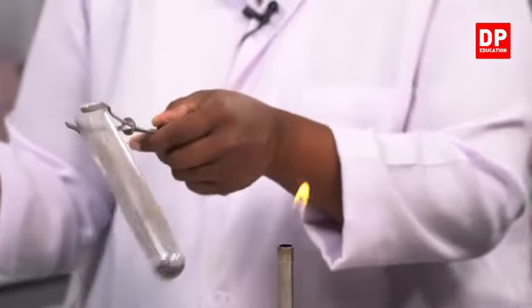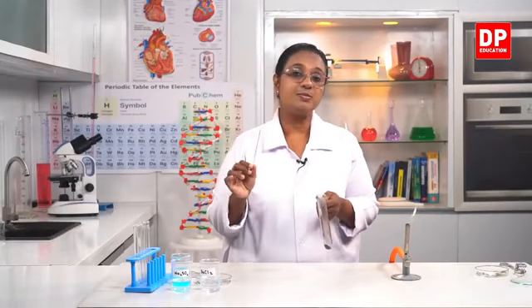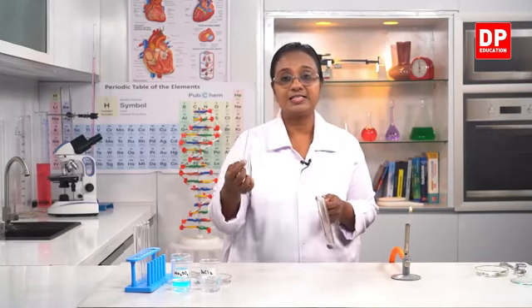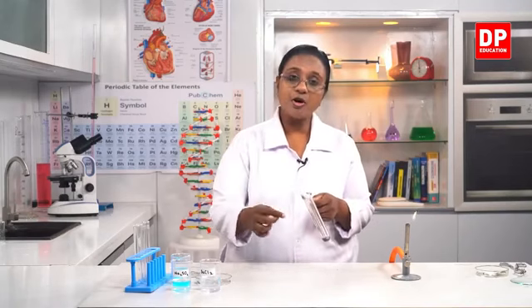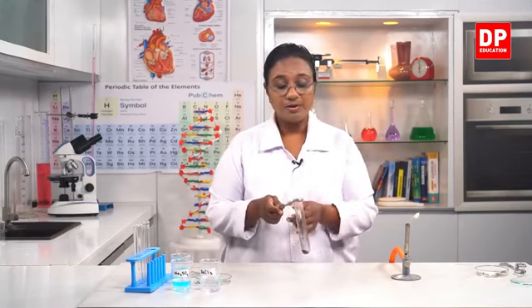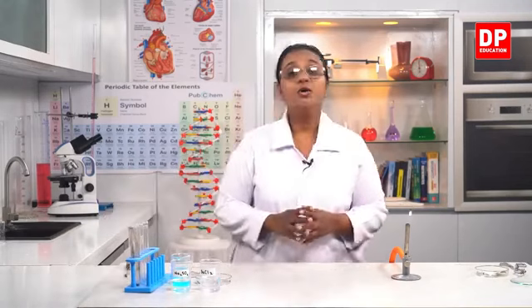So you all know, students, when there needs to be combustion, there has to be oxygen gas. So we use the glowing splinter. When I inserted the glowing splinter, you all saw it rekindled and it started burning. So that means oxygen gas evolved from the potassium permanganate. As I told you all before, potassium permanganate, initially it is only one substance, one reactant. When we heat it using the Bunsen burner, the potassium permanganate gets converted to different products. It becomes potassium manganate, manganese dioxide, and also oxygen gas is liberated.